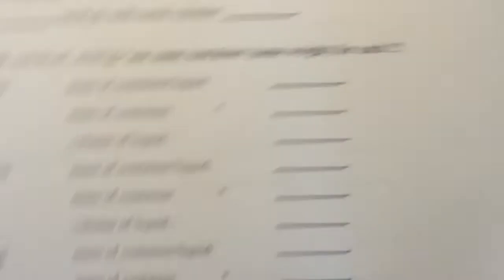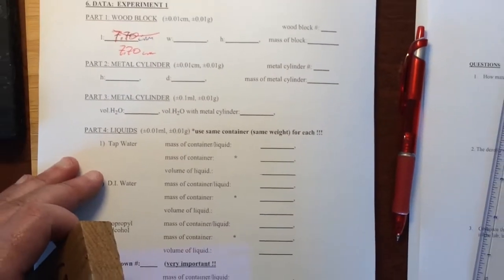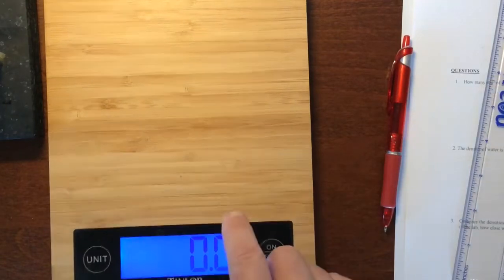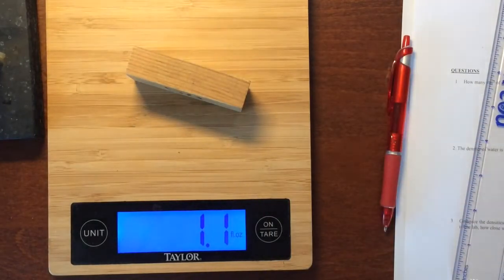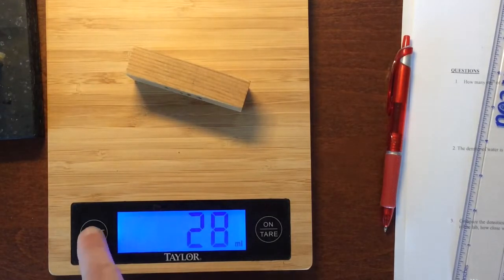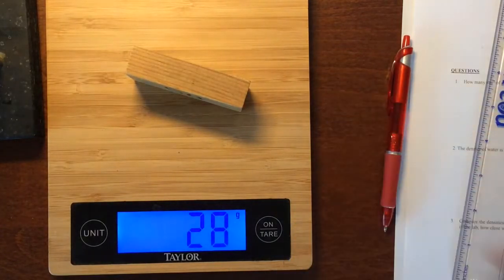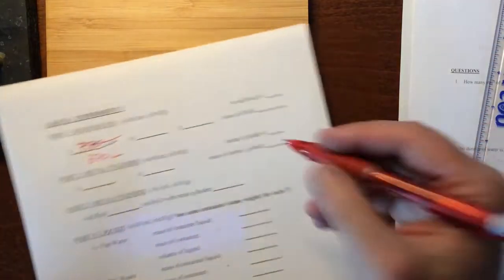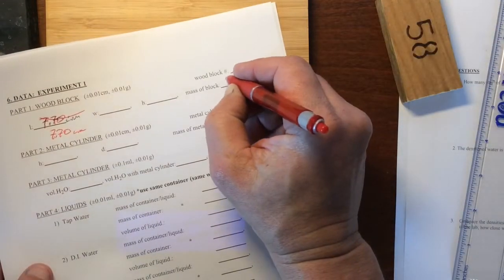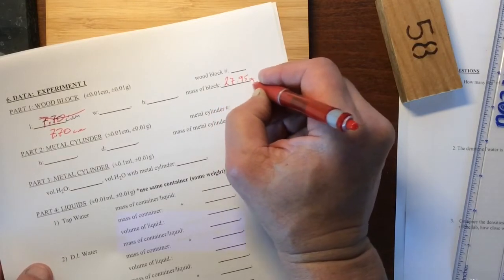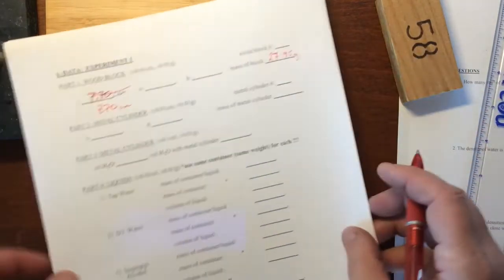The other thing we need to do is find the mass of the block. We happen to have this high-tech kitchen scale, and we want this in grams. My scale doesn't go out to the hundredth place. Let's say that this guy is 28 point, we'll say the mass was 27.95 grams. To kind of make that up, it's the best I can do.